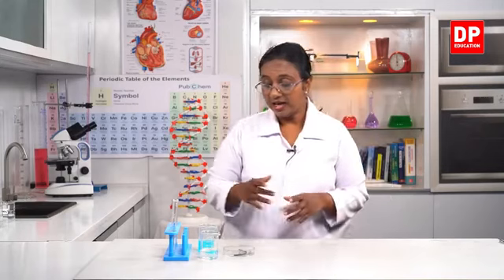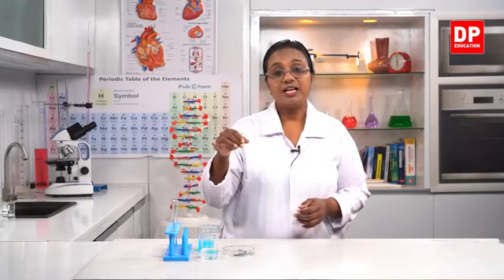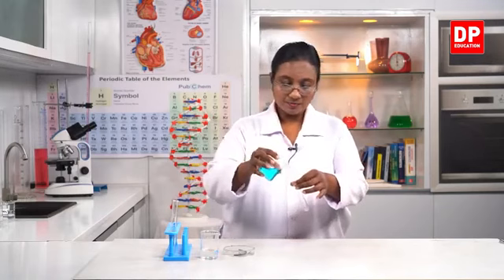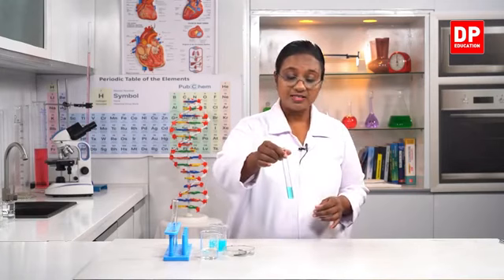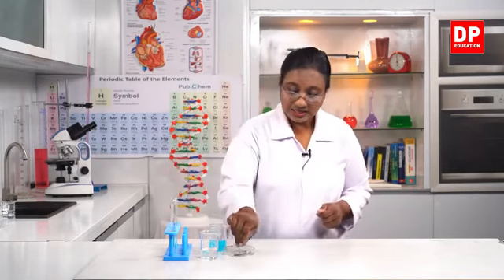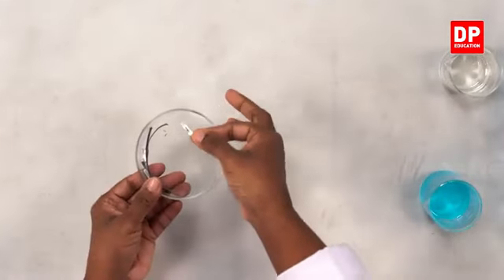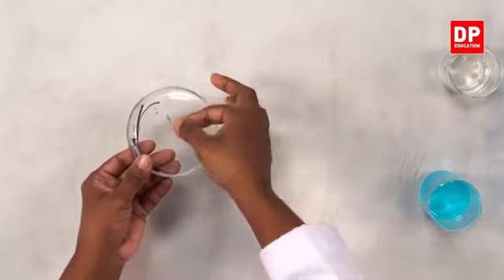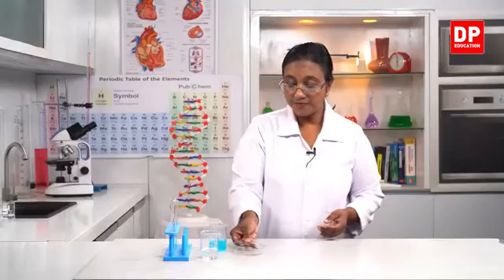To do this activity, I have copper sulfate solution, magnesium strips and hydrochloric acid solution. So first what I will do is I will take a small amount of copper sulfate into a test tube. Here you all can see clearly, students, you are familiar with this solution, the light blue color solution of copper sulfate. Then I have the clean strips of magnesium. Normally the oxide layer covers the magnesium strip. I have cleaned it now. So I have a few pieces of clean magnesium strips, and I'll be using that for the activity.